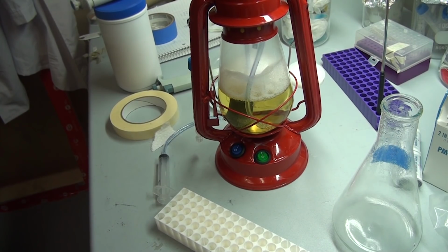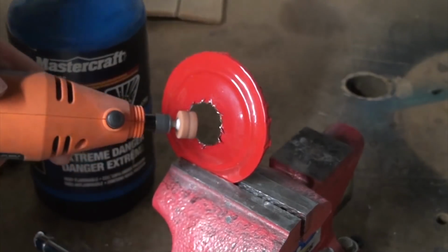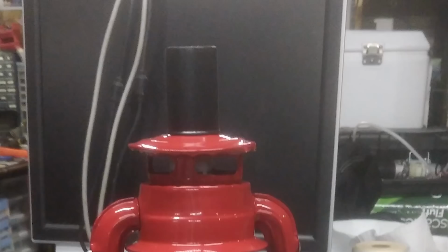Because I wanted the whole system to be very portable so I could easily show it off and move it around even when it's fully loaded, I picked up a tiny air pump to fit into the top, but it was still a bit too tall to leave enough room for the tubing and wiring and such. So I modified the lid of the lantern to fit the pump's motor, and then made a cap out of an old film canister to cover and protect it.